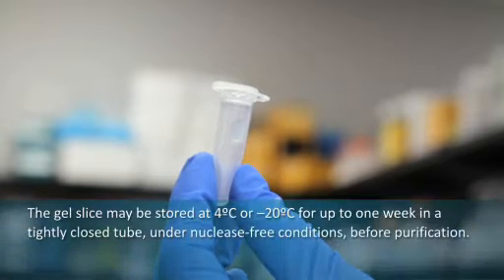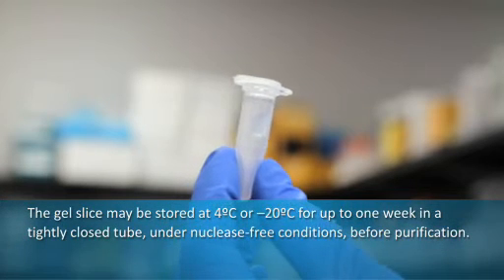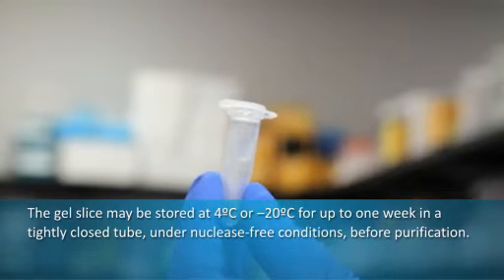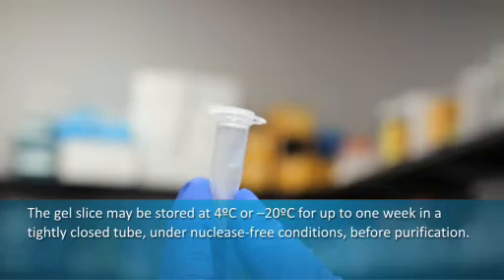The gel slice may be stored at 4 degrees Celsius or minus 20 degrees Celsius for up to one week in a tightly closed tube under nuclease-free conditions prior to purification.